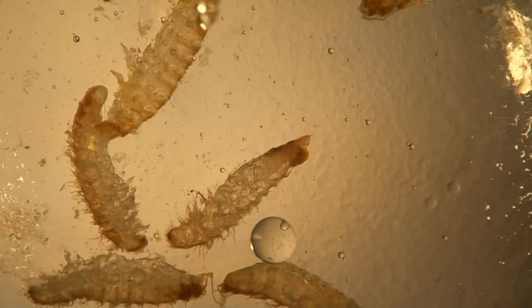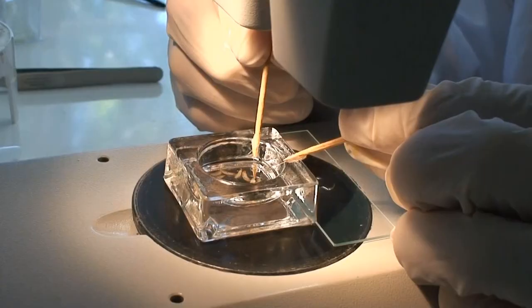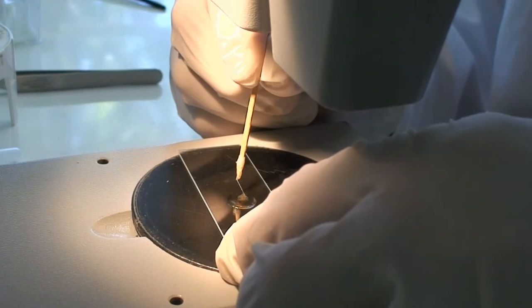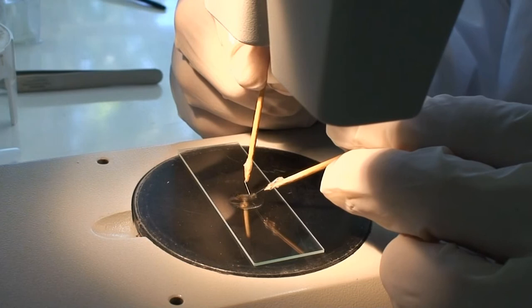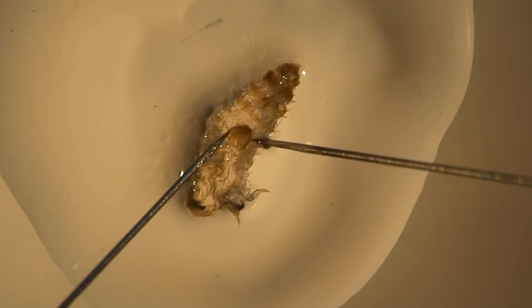Here we are using a circular-ended homemade micro tool to place a larva onto a microscope slide. The larval skin is then carefully butterflied open with the legs fully visible. The head should be detached, with the mandibles detached and mounted dorsal side up. If the clearing process was successful, the epipharynx and antennae will be clearly visible.